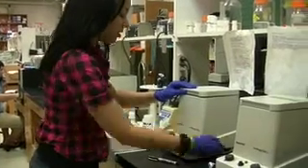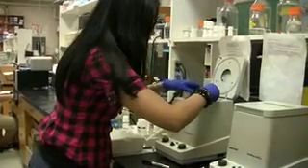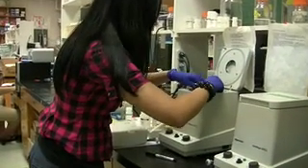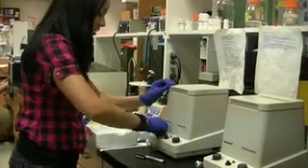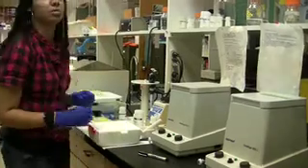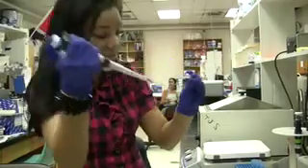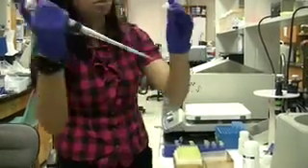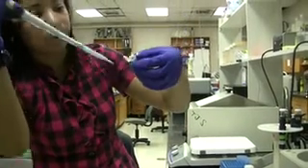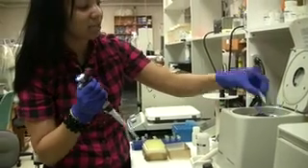It's been on the ice for five minutes, so I'm going to go ahead and turn the centrifuge on. Place them in the centrifuge, making sure they're balanced. Cover it up and centrifuge for five minutes at max speed. I'm taking the liquid, not touching the pellet, and I'm going to transfer it to the lysate column. You can see the pellet at the bottom — you want to leave that in. This is done centrifuging for five minutes at max speed.